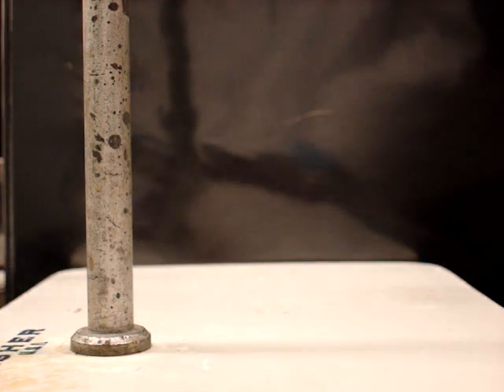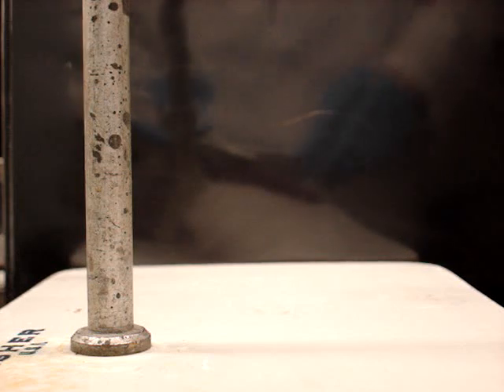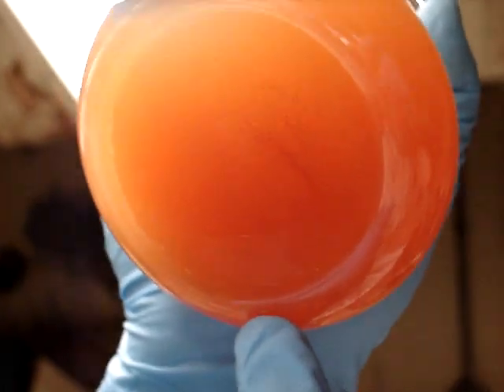See if you could shine the camera so you can zoom in there. Right. So I'm holding it up against the light. Can you see those little dots if you zoom in? No, I can't.